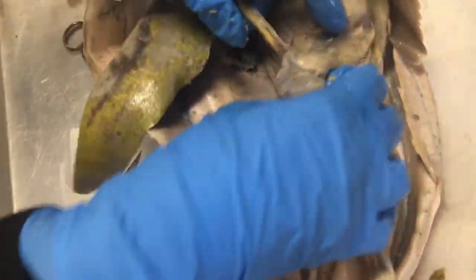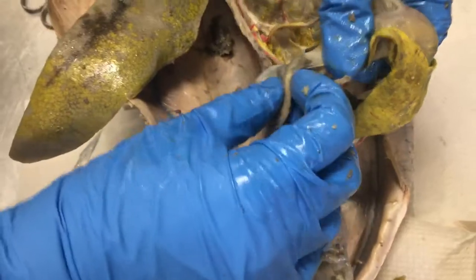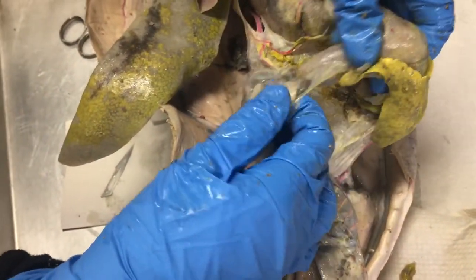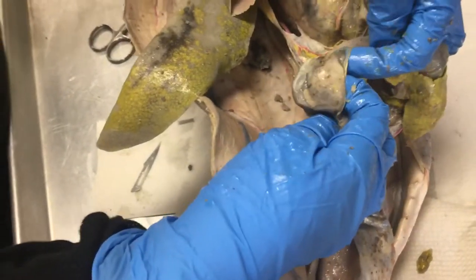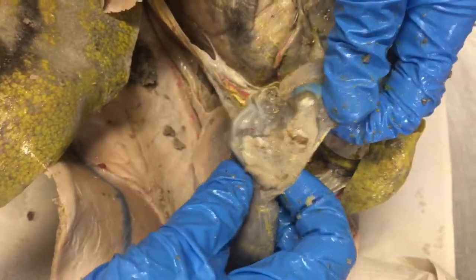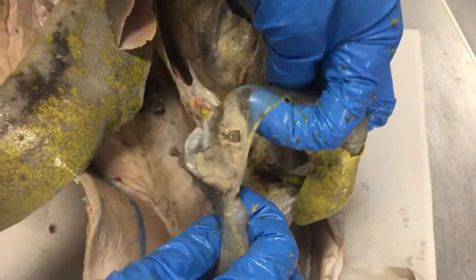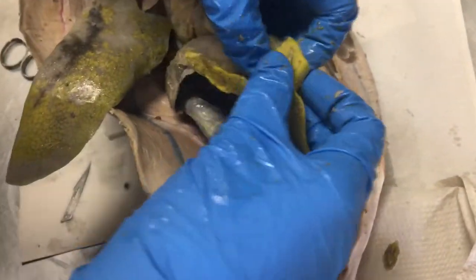The pancreas is that small part — it's kind of like a flap that overlays the pyloric section of the duodenum of the small intestine. You can put your finger under it; it's usually attached by a small thin membrane to this section, not really adhered to any of the actual organs, just by the membrane. And then you have the spleen.